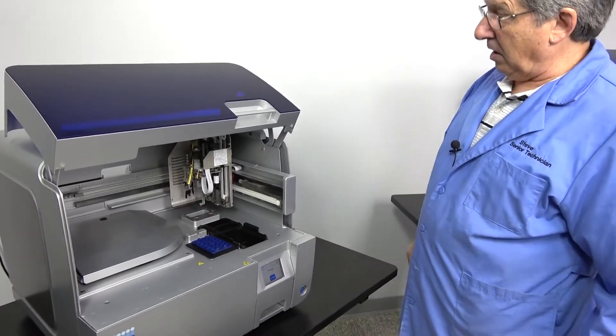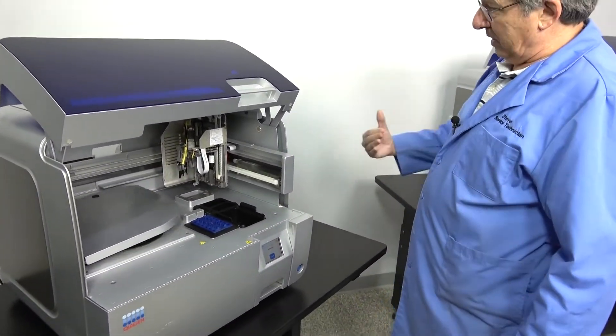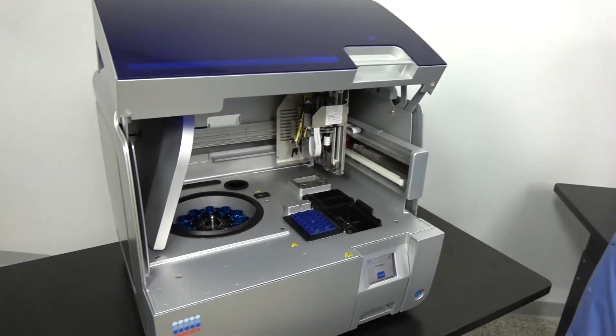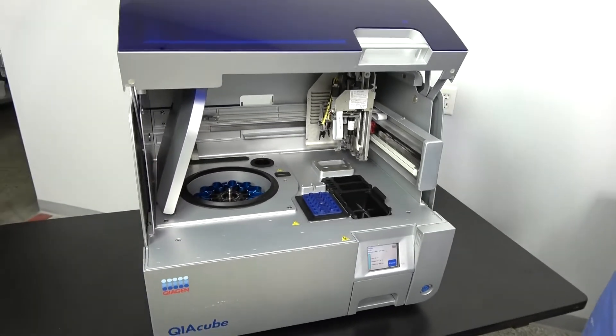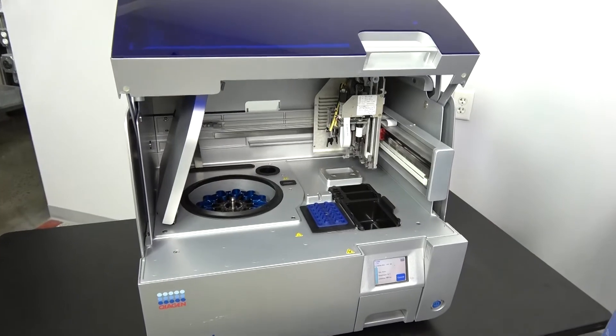Here we're going to test the shaker. Every step it does reinitialize, do a basic reinitialization of the unit. There's a run of the shaker.